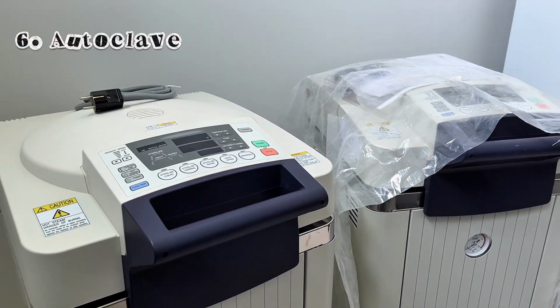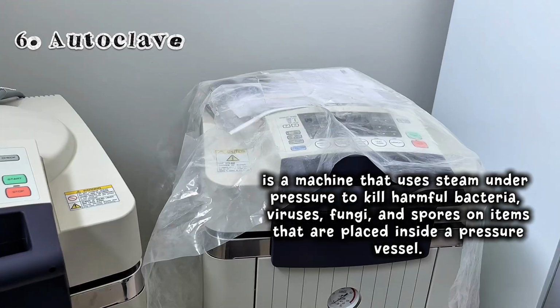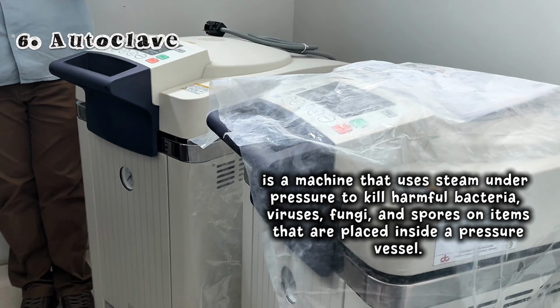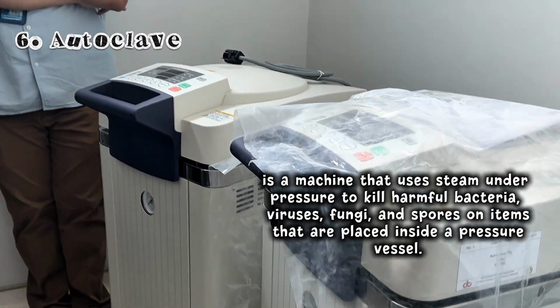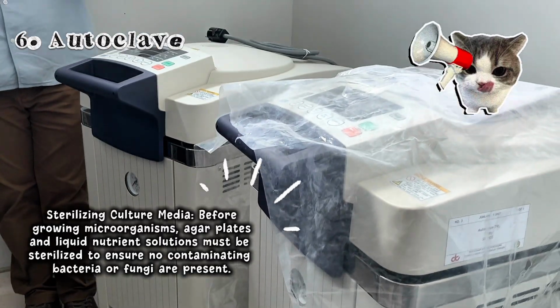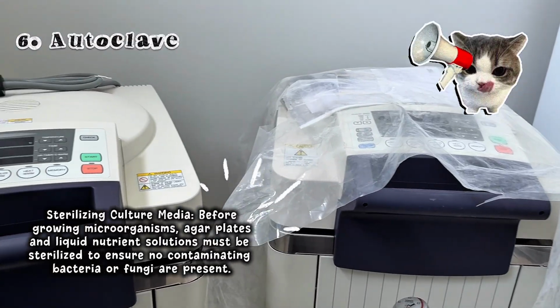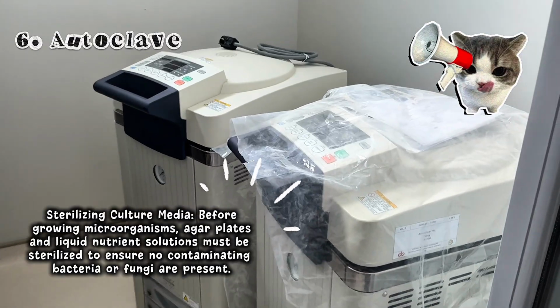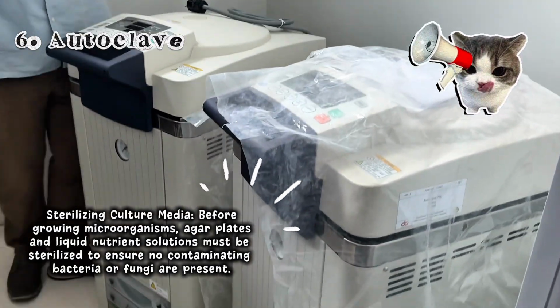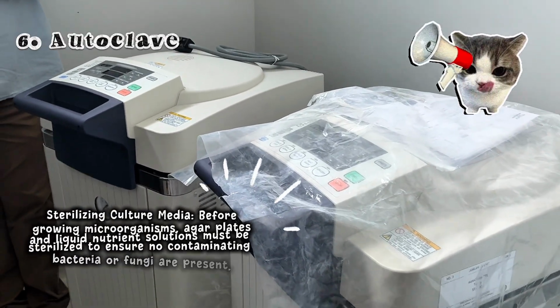This one is called the autoclave. It is a machine that uses steam under pressure to kill harmful bacteria, viruses, fungi, and spores on items placed inside a pressure vessel. This equipment is used in some experiments. One of them is sterilizing culture media. Before growing a microorganism, agar plates and liquid nutrient solution must be sterilized to ensure no contaminating bacteria or fungi are present.